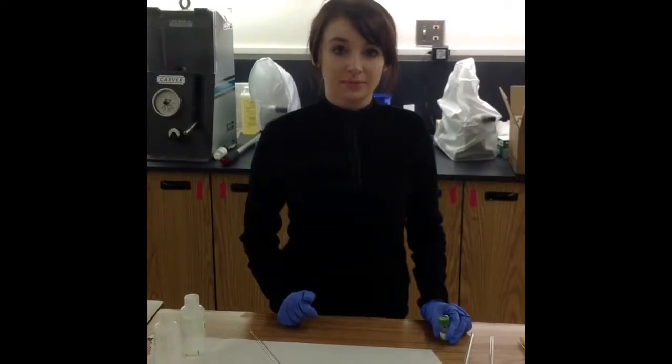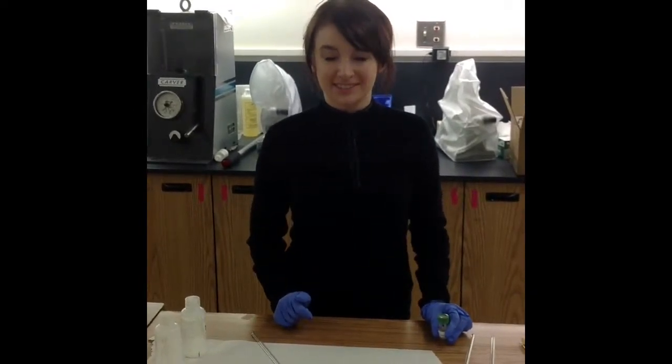Hi, I'm Christy, and I go to Schwann Community College, and today I'm going to show you how to work with the GC.